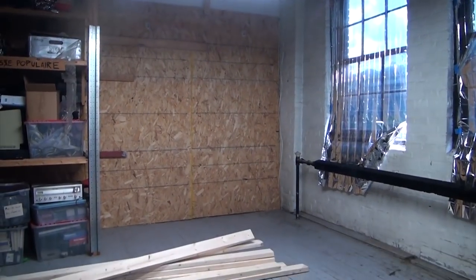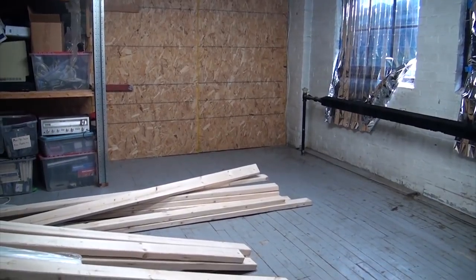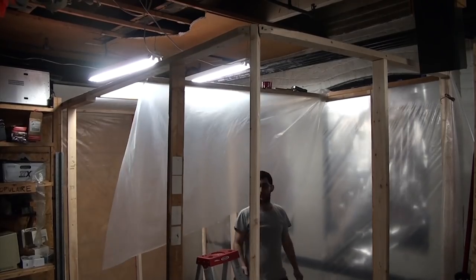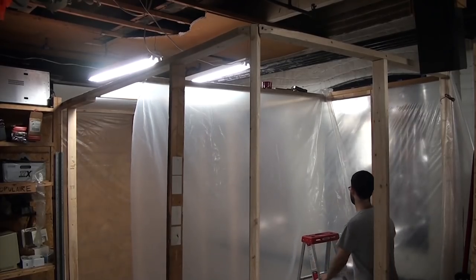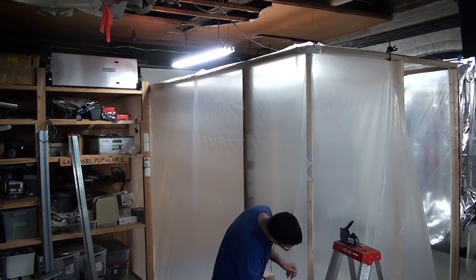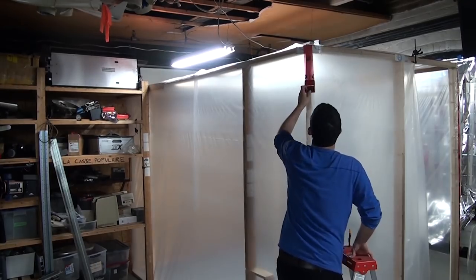With all that out of the way and a nice clear area to work, we could start on the build. The design is actually very simple. The room will be built out of a 2x4 frame that's 12 feet long and 7 feet wide. Then both sides of the frame will be covered with plastic and sealed well with construction tape.